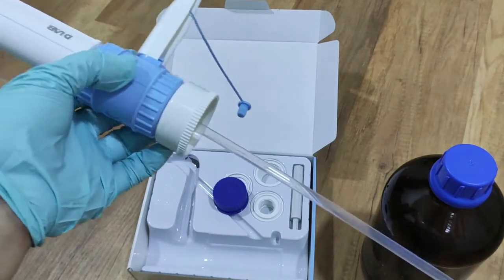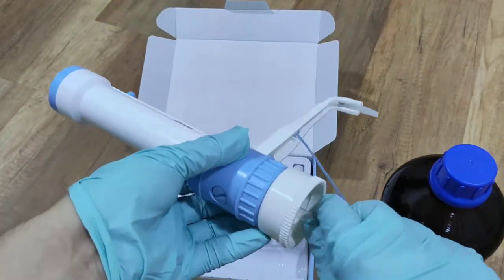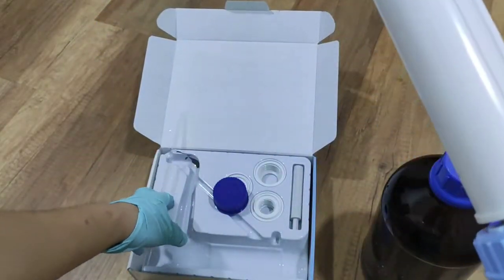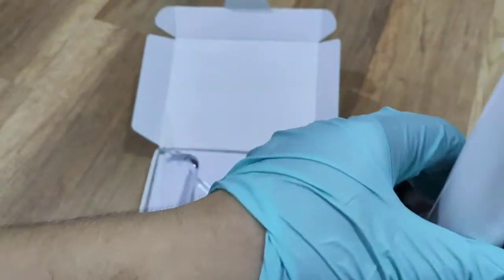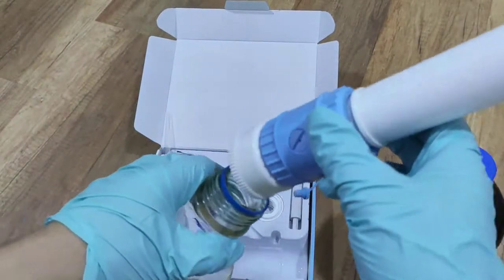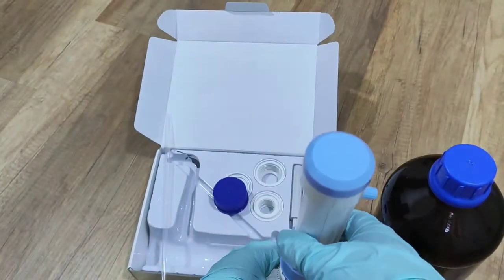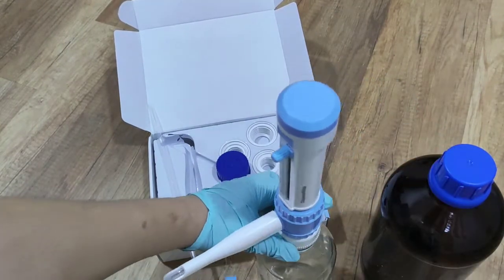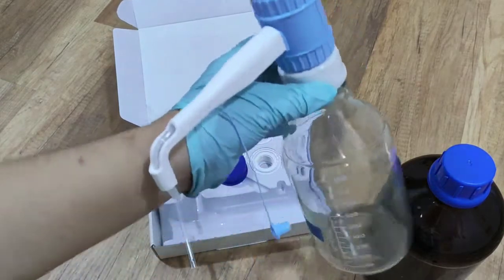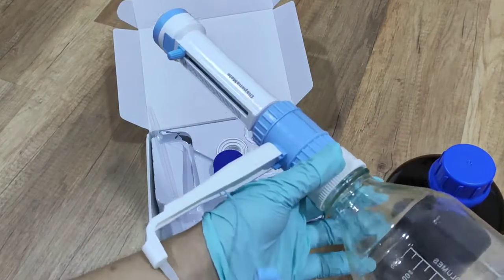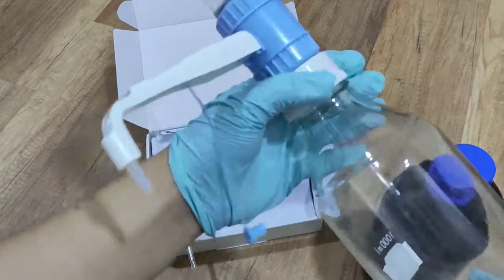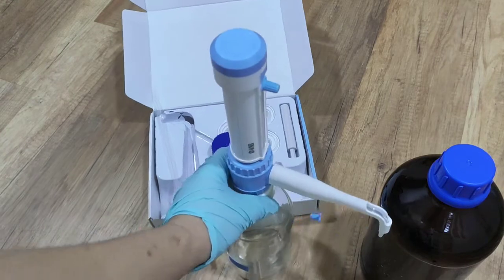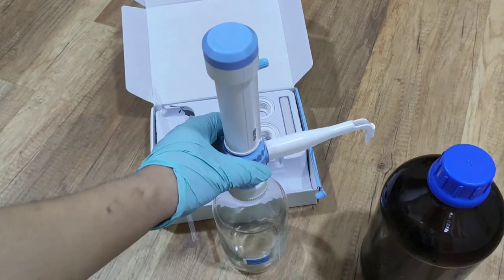So now, today I'm not going to cut because I don't have any liquid. So I'm not going to cut. I just want to show you how this thing is going to work. And now I will connect this bottle with the dispenser. Tighten it up. Now it is tightened. It's just like this.